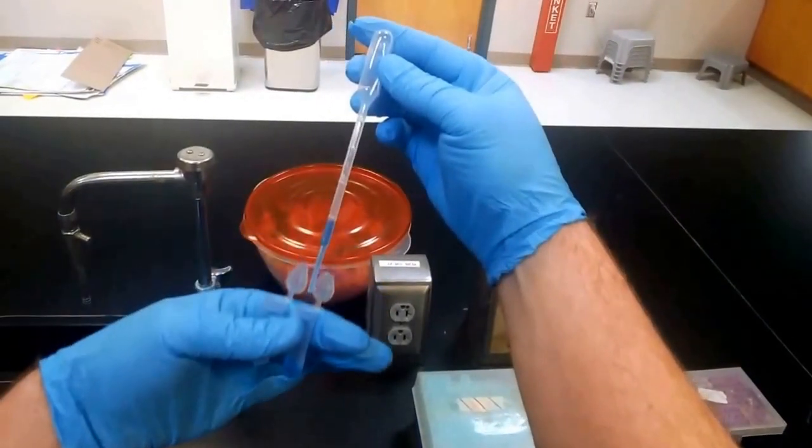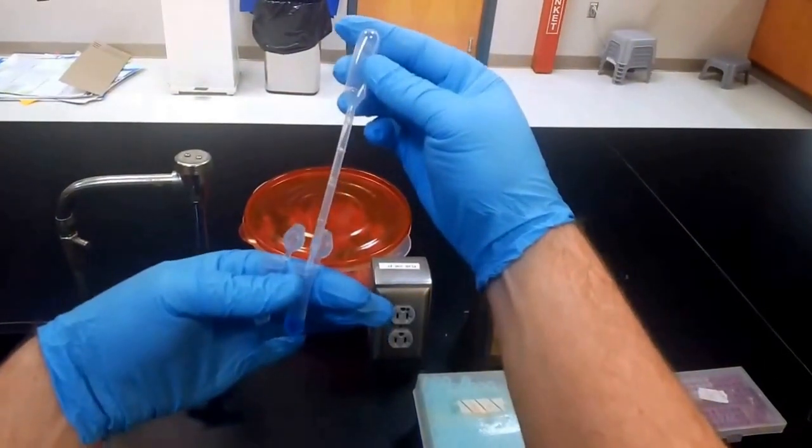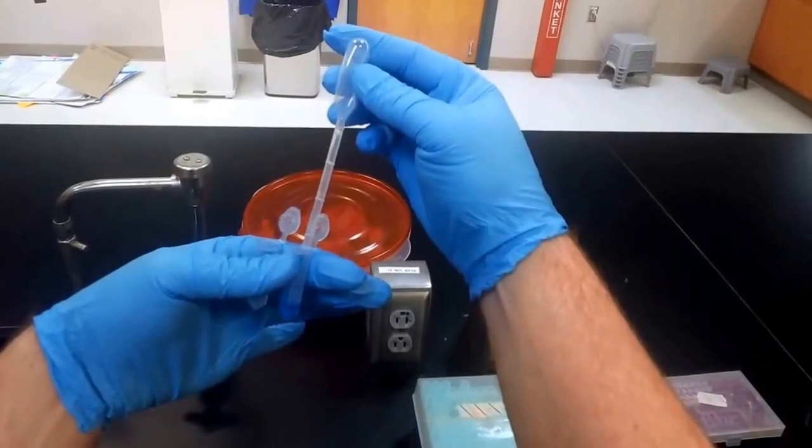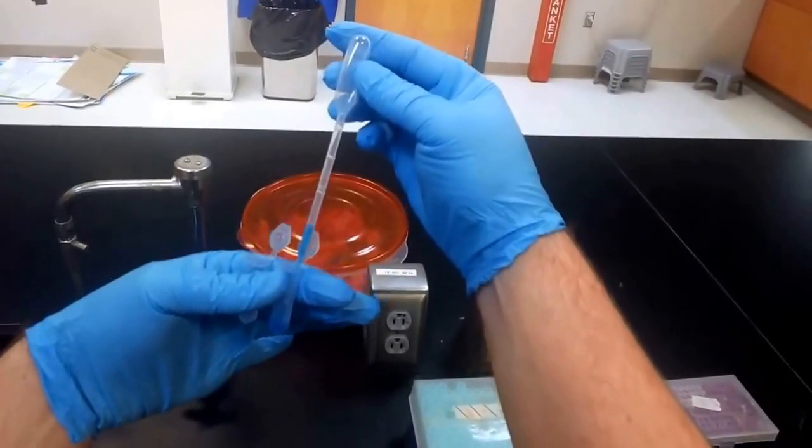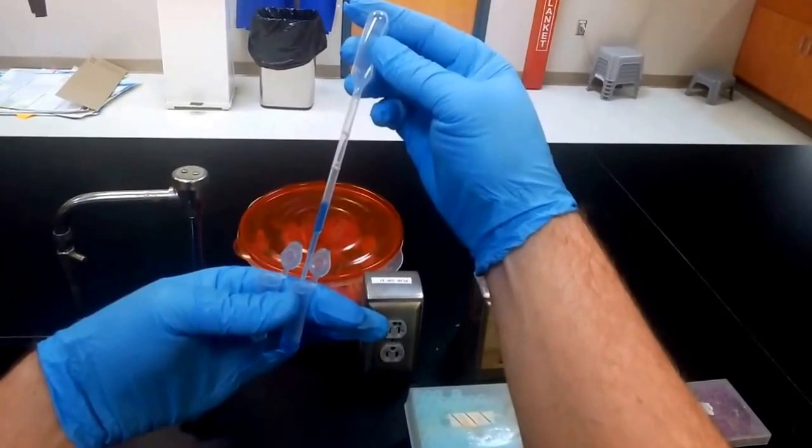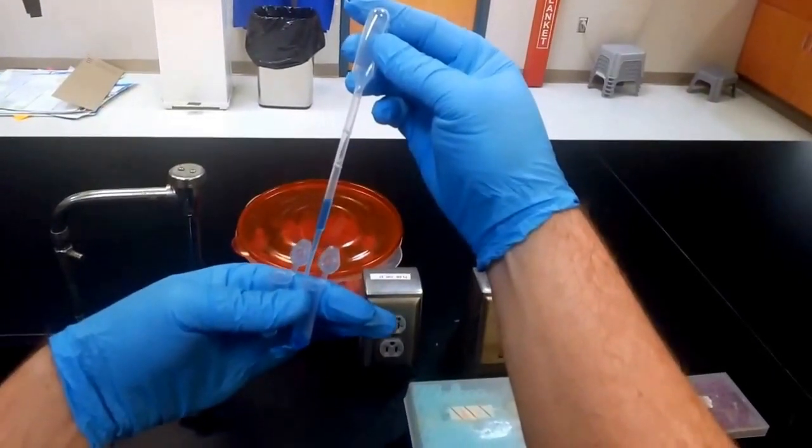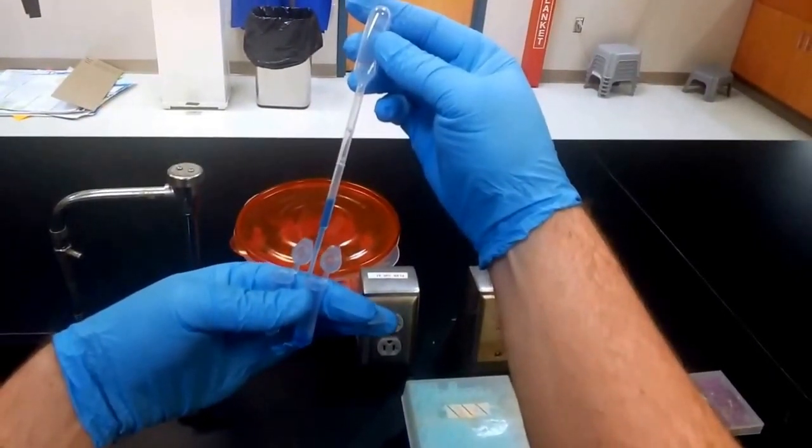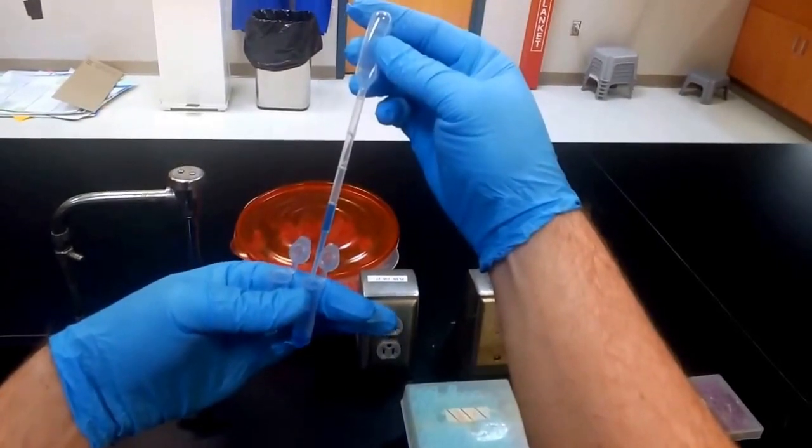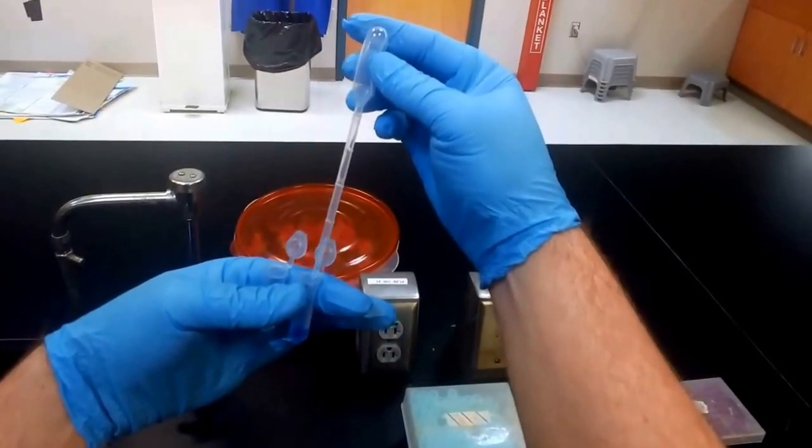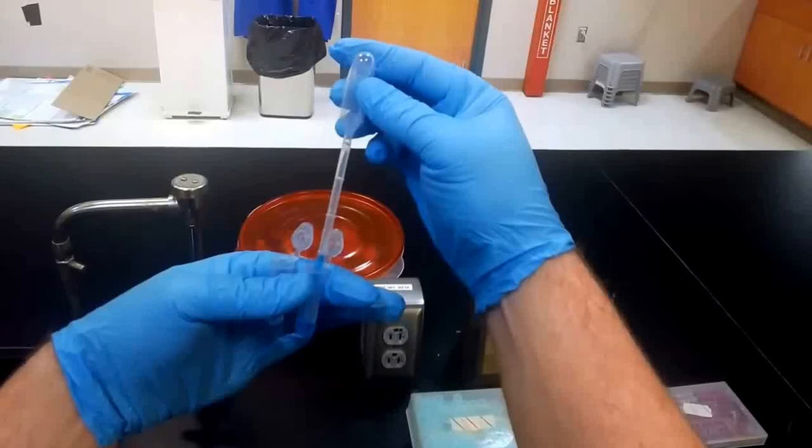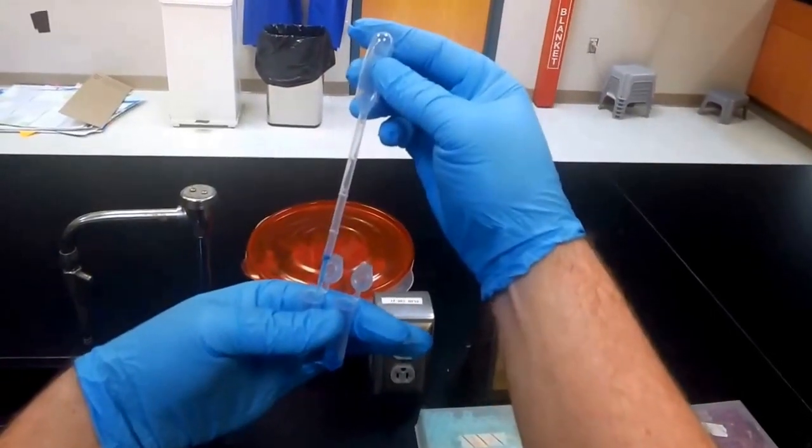So that's possible, but you'll kind of notice here that it's difficult to get it precisely, and the sort of shaking that's just common to one's hand is causing it to go up and down a little bit there. So it's not very precise, but we can move that quantity.